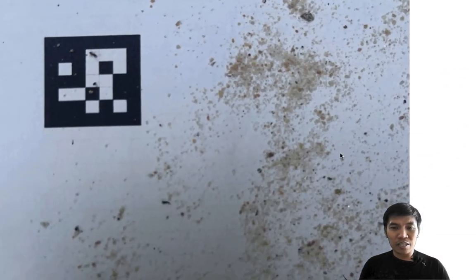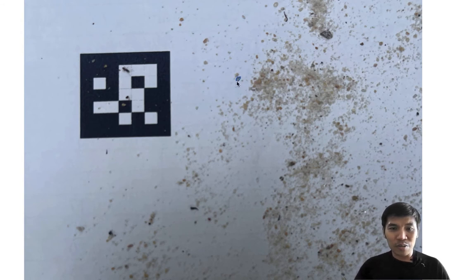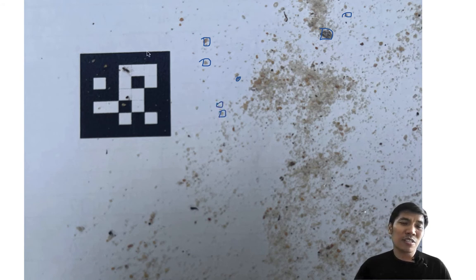This is sand I got from my kid's sandbox. I place the sand particles onto paper. If I have some tool to capture the size of the sand, the computer can do it with reference to a target.